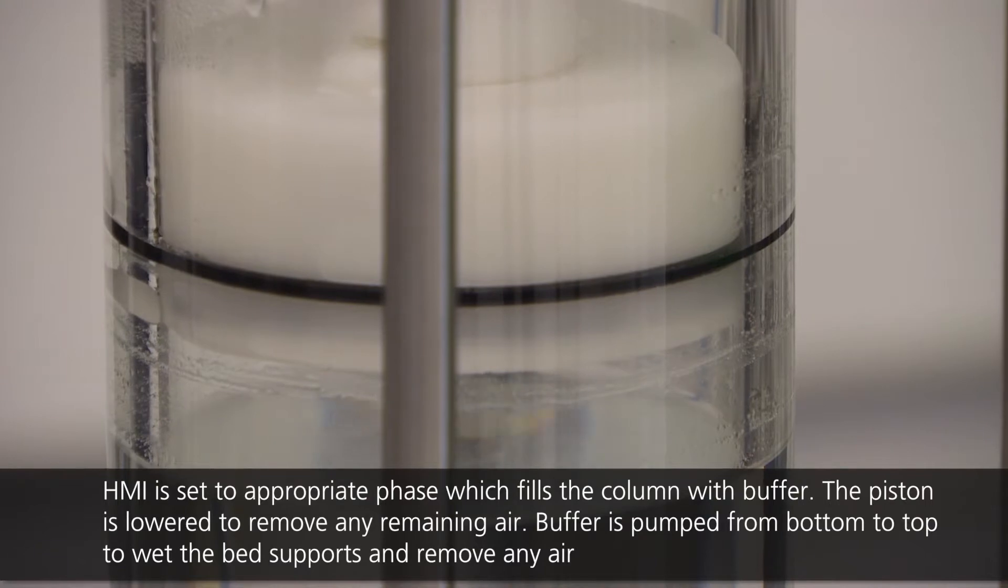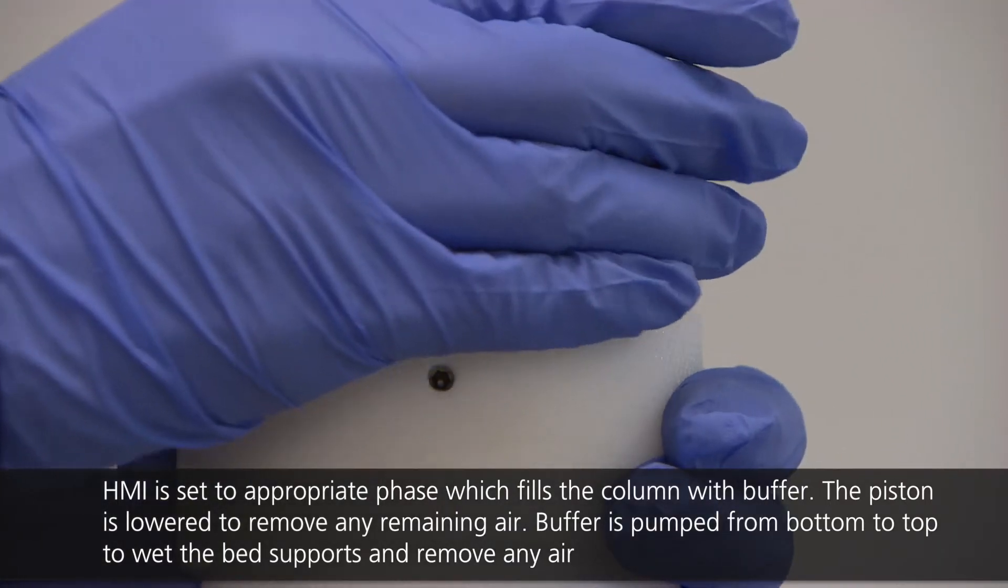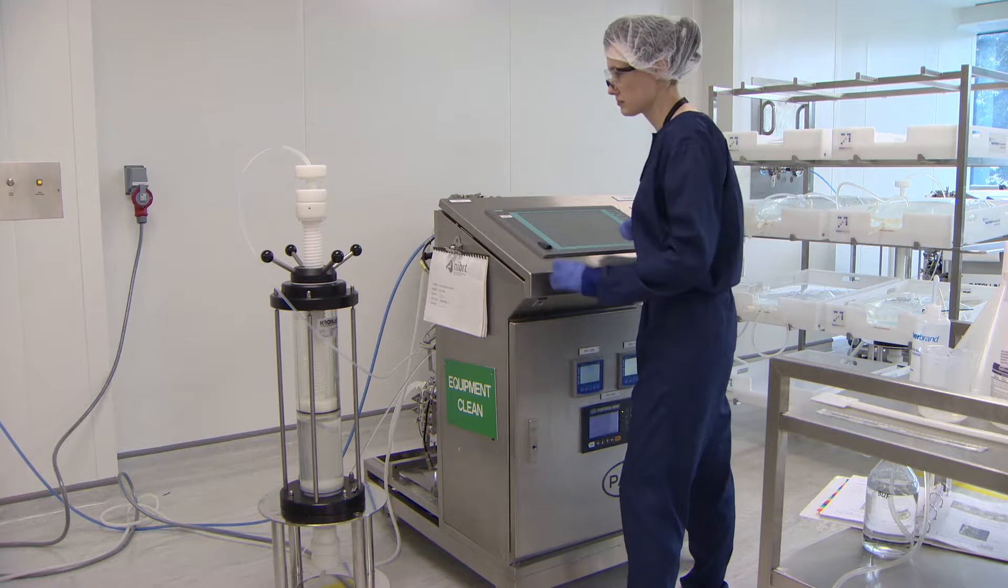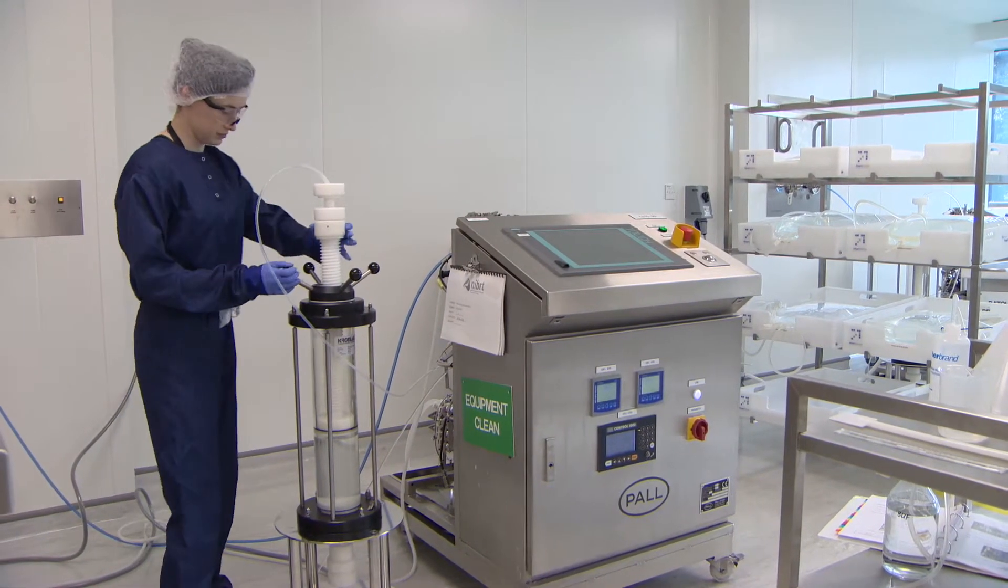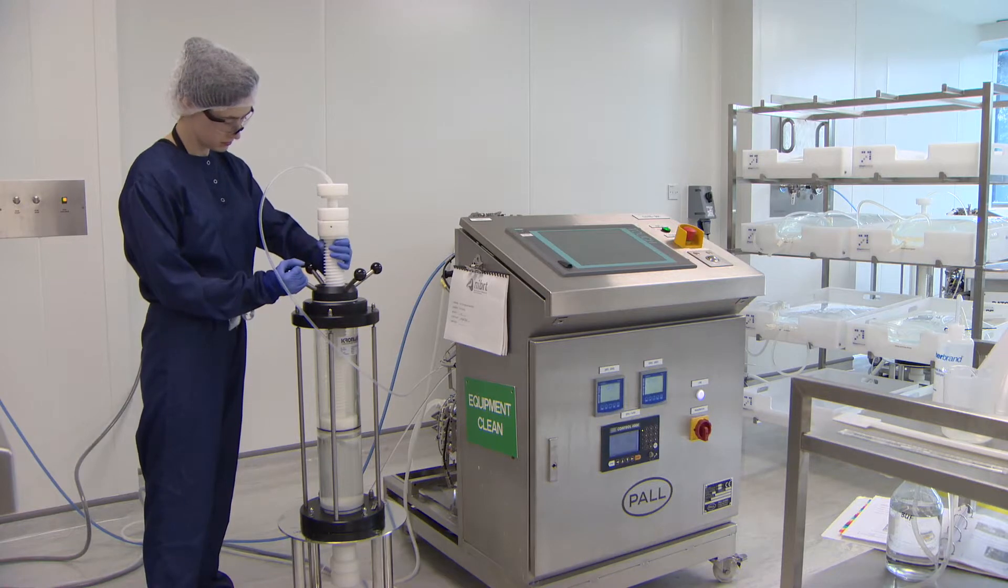The top bed support is lowered until it comes into contact with the buffer.